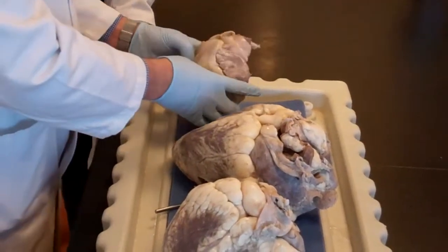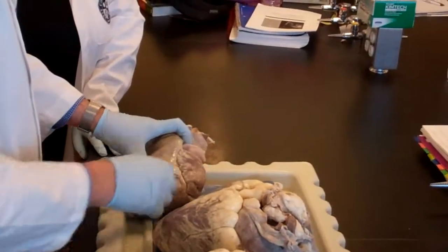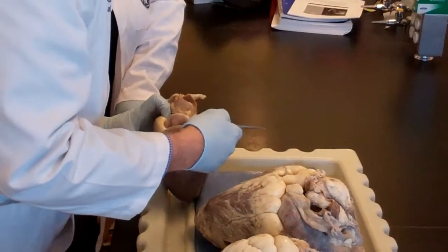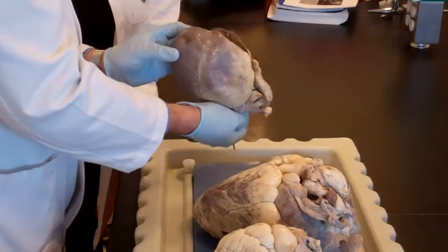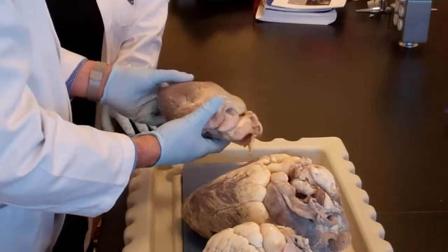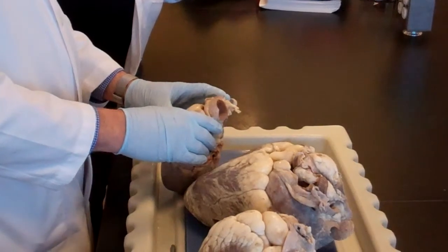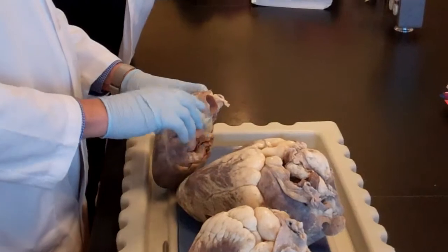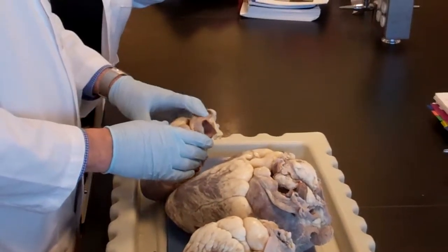Now, this is the anterior surface of the heart. So this has to be the pulmonary trunk. You don't believe me? So we're going to put this here, okay, a probe, and see if it comes out from this side. But supposedly it is in the right ventricle. You're going to believe me. This is not my cut. So I'm not involved. Here is the aorta, aortic arch with its three branches. Okay? So think about it as it's going this way, and this was chopped off.